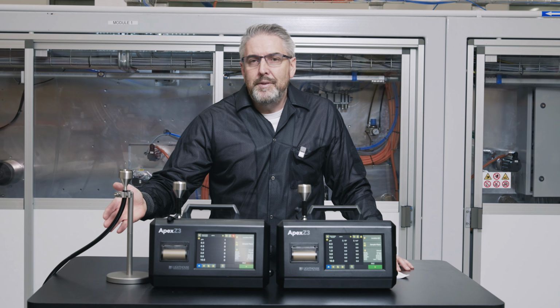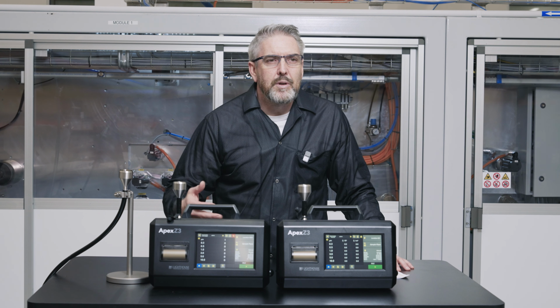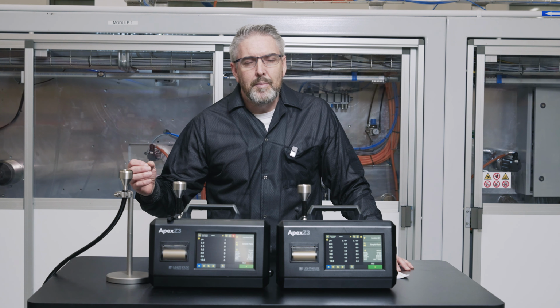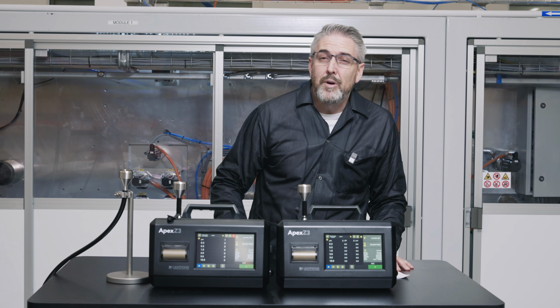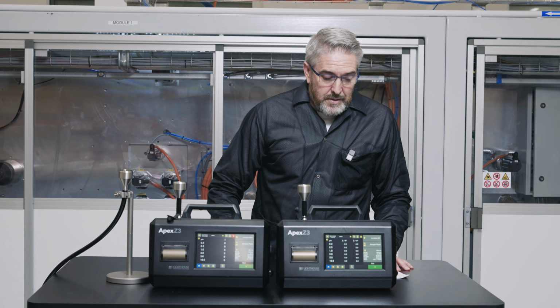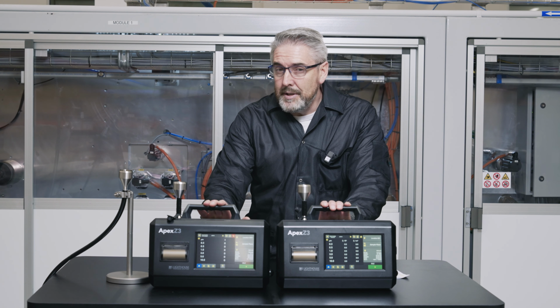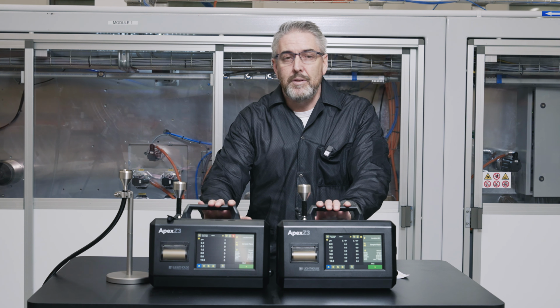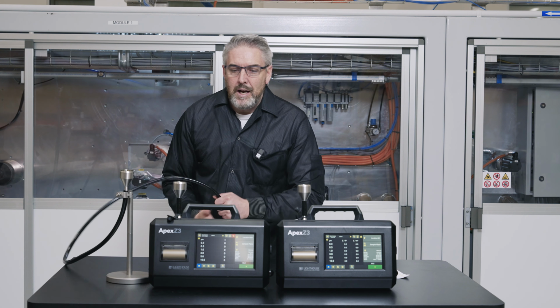And the tube length that we're going to use for the test is about 3 meters. We're also going to do a second test with reduced tubing length, around 1 meter, to give you an idea of the particle losses around the 5 micron sizes. So part one, we're going to test the two particle counters together without any sampling tubing to generate a baseline reading.